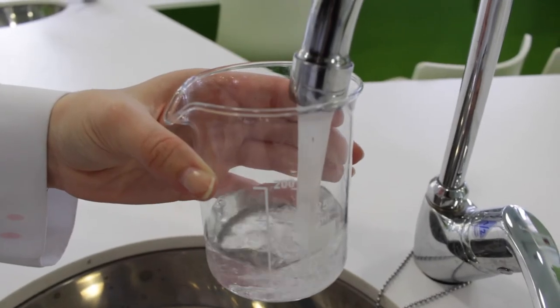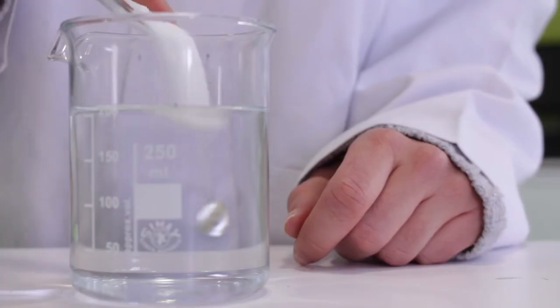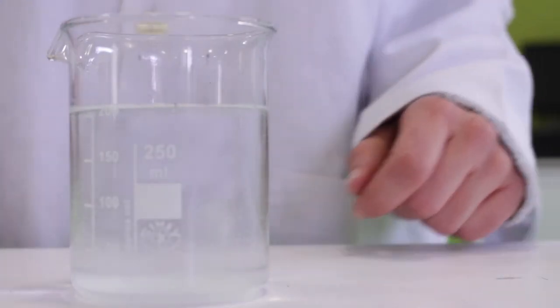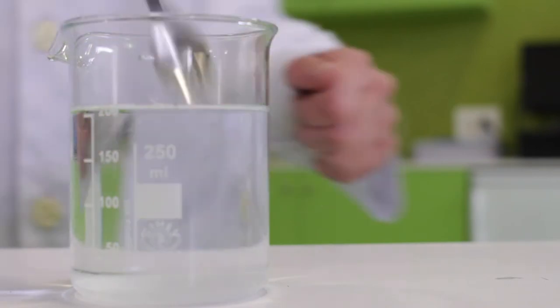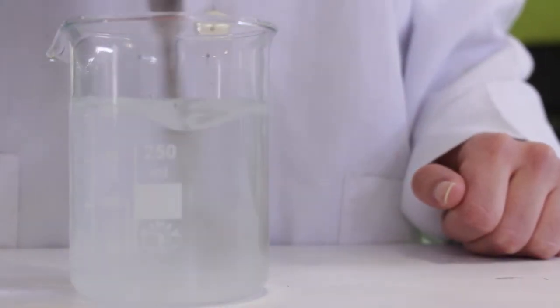In order to test the physical property, solubility, we'll first fill a beaker with water. We'll introduce the materials there. First up, we'll introduce the salt and see how it starts to blend with the water, even more after we start stirring it thoroughly.